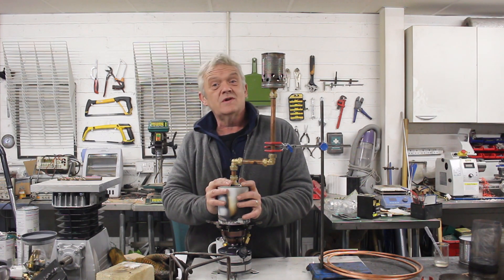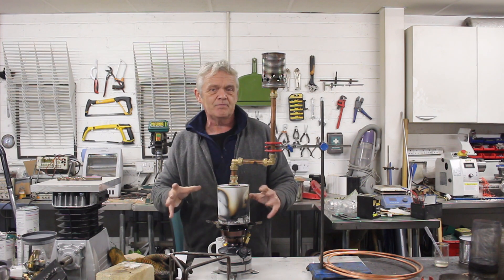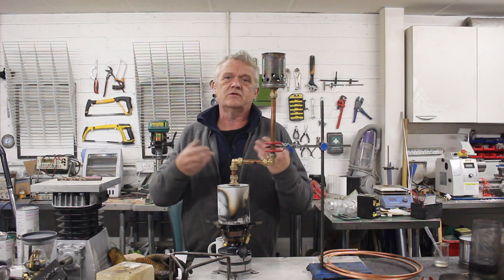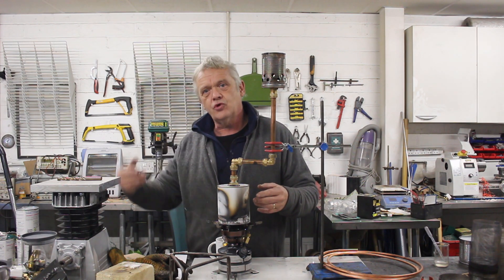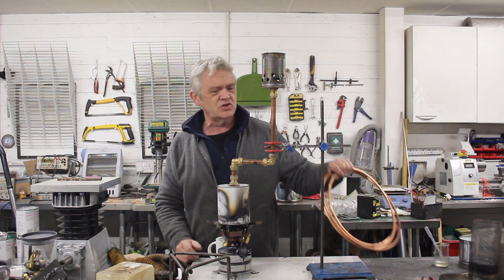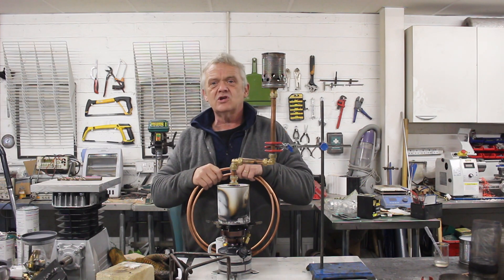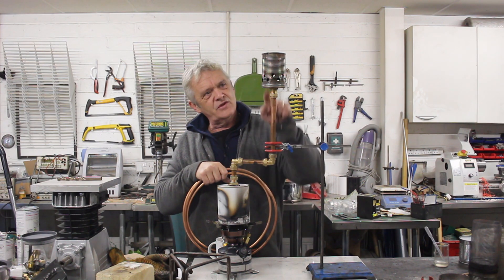If we do something else with it, we can get lots of methanol. So what we need to do is change that up a little bit so that we capture that liquid. The liquid is hot and has turned into a gas, which is why it's boiling off. If we capture it and cool it, we can drip it into a container and we'll have our methanol. So we're going to change this slightly into a distillation setup.